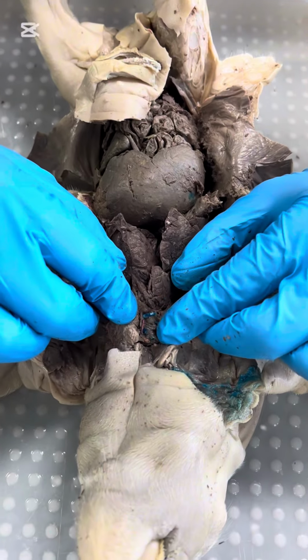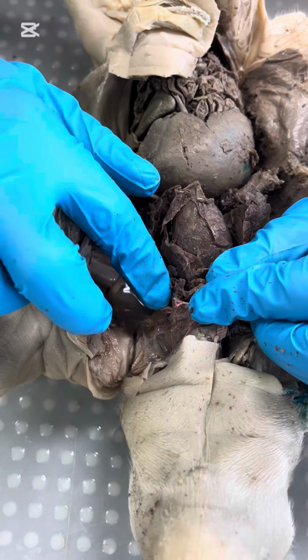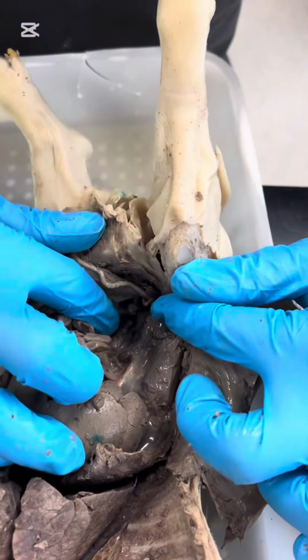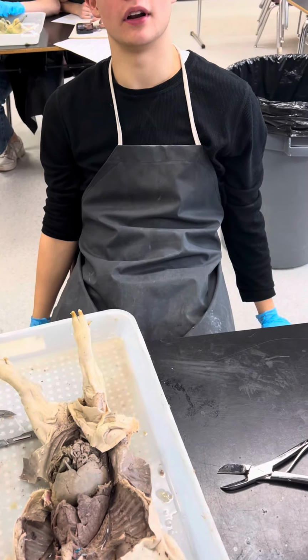So the blue we have here is the subclavian vein. As we move on over to the right, we can see that the red is the subclavian artery. So entering the kidney would be the renal artery, and down below we have the iliac arteries down in this area over here. Now we will show you the urinary tract.